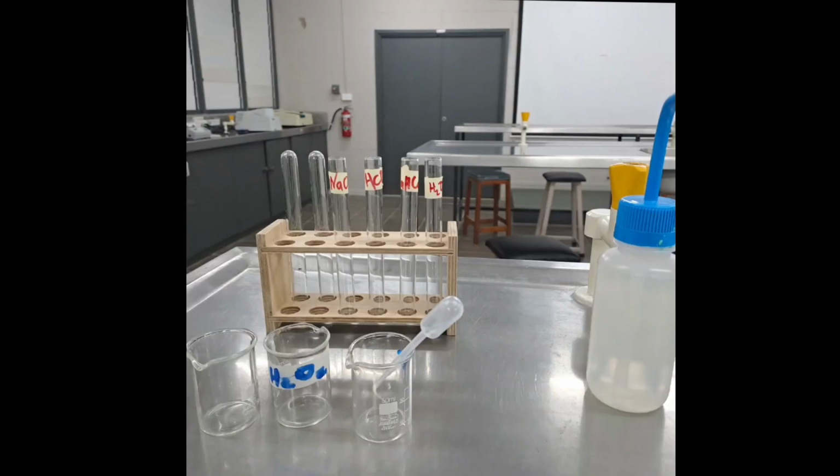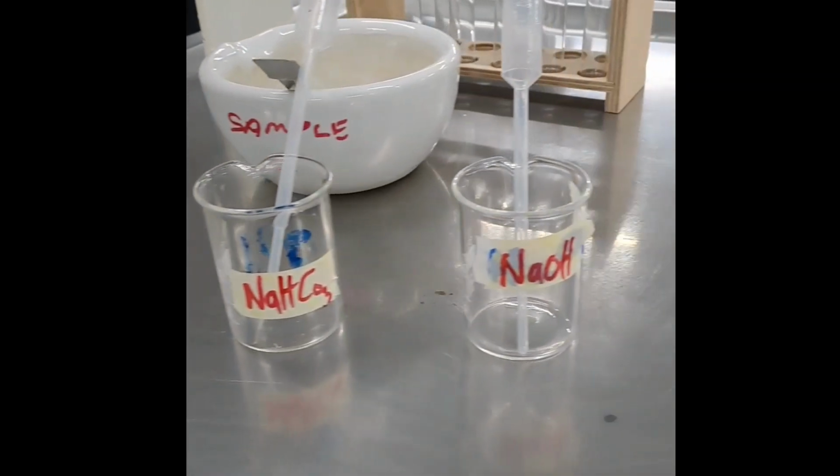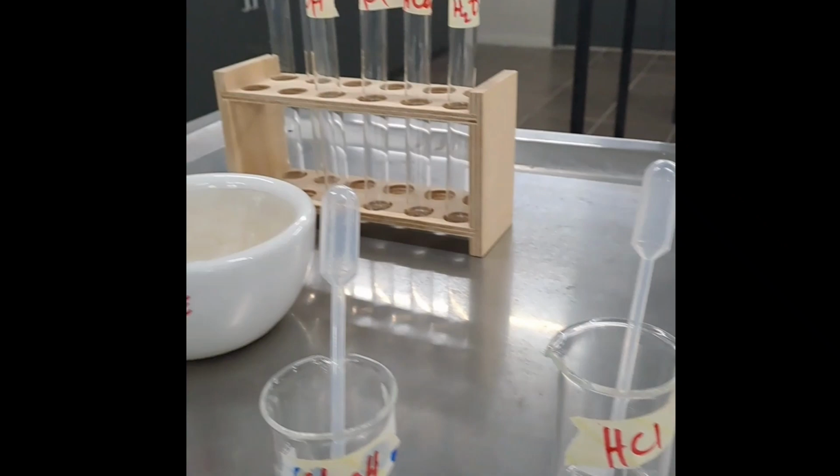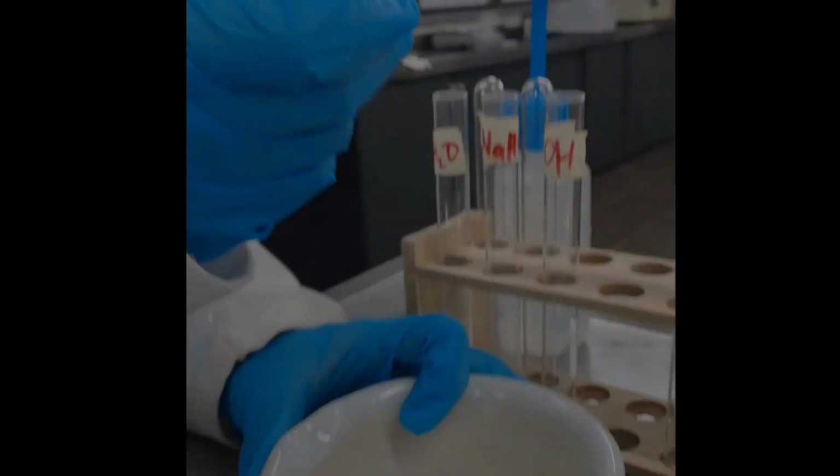Today we are going to be doing a project proposal 1, which is based on solubility test and melting point test. The aim of our project is to determine the chemical nature of the given unknown compound. We are going to start off with our solubility test.